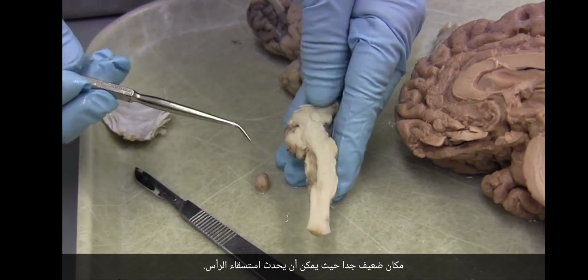So front to back, and then around to get that temporal lobe. Can't forget the temporal lobe. And there it is. That's the end of the lateral ventricle in the temporal lobe.